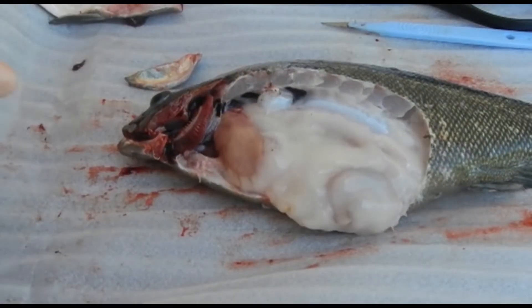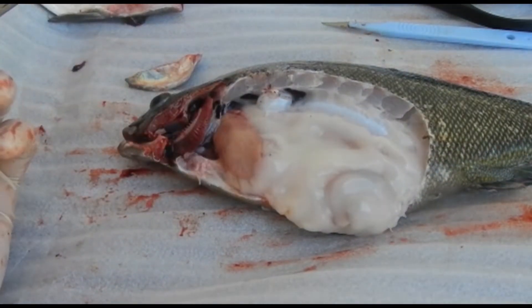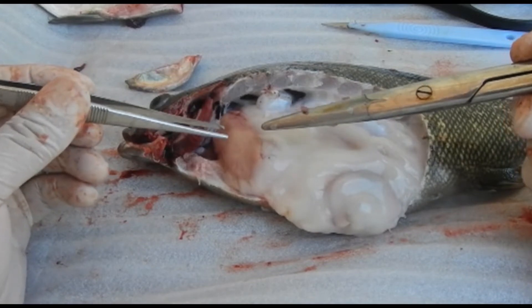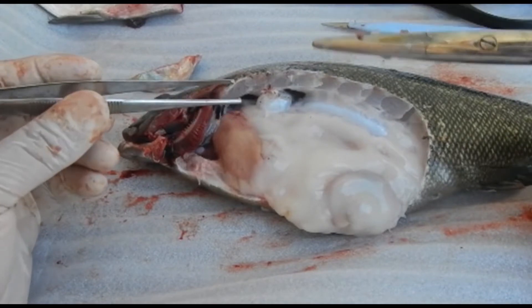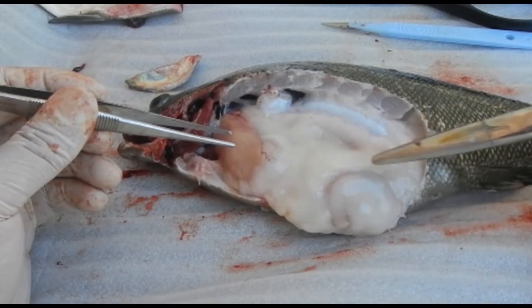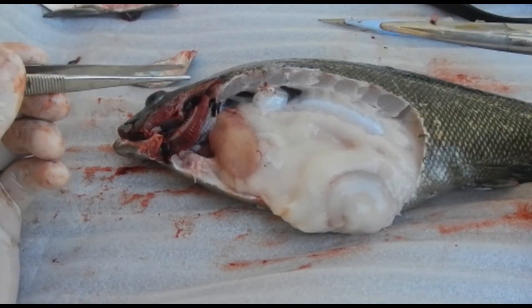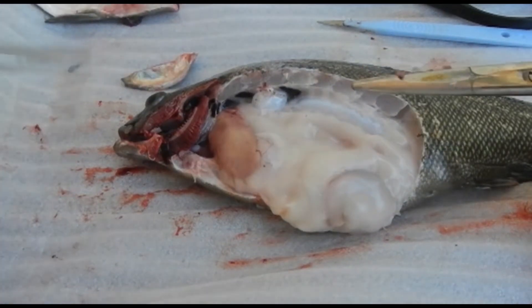Having a close look at the fish, we can see all the organs. There's a lot of fat in here, which is typical of cultured fish. The liver is sitting in the cranial portion and is quite a discrete organ in the silver perch. In koi, livers tend to be more diffuse. In rays and sharks, the liver tends to occupy much of the ventral aspect of the coelomic cavity, acting as a buoyancy device because they have no swim bladder.